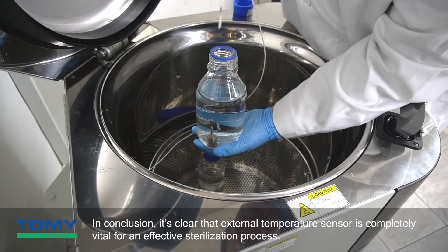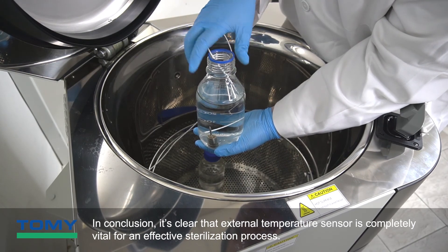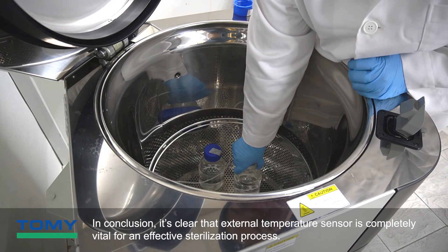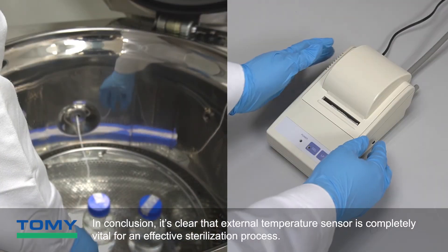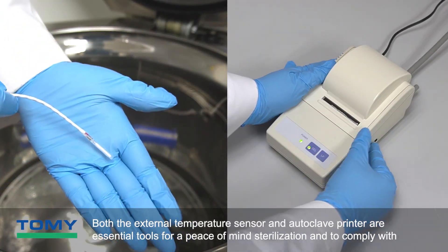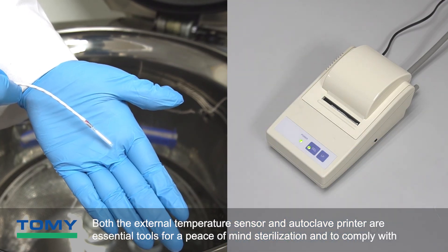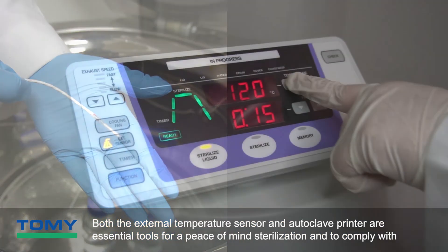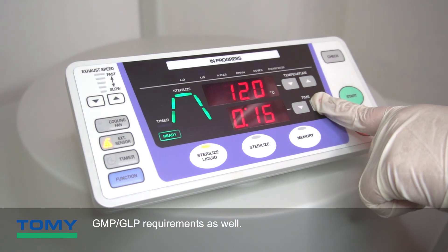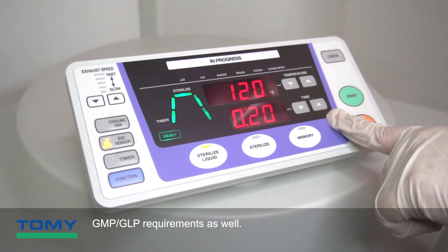In conclusion, it is clear that the external temperature sensor is completely vital for an effective sterilization process. Both the external temperature sensor and the autoclave printer are essential tools for a peace-of-mind sterilization routine and to comply with GMP and GLP requirements as well.